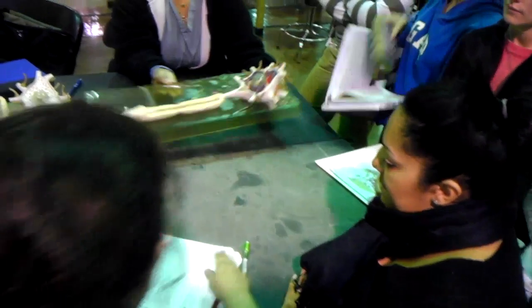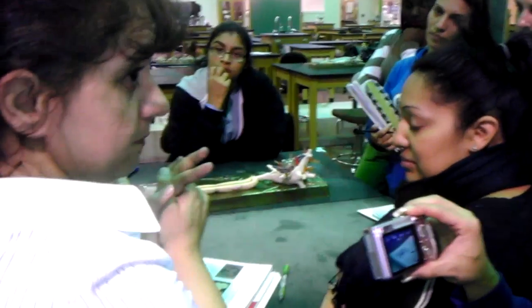All right. The exercise for tonight is exercise number 16. There is a slide here. I'm not sure if the picture is taken in the new version. We used to have this slide of the longitudinal section of the nerve, but I couldn't find it. I'm not sure that they will have it for the test or not, but I will ask.